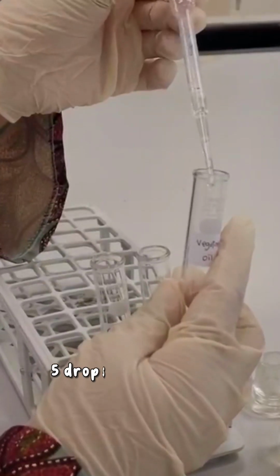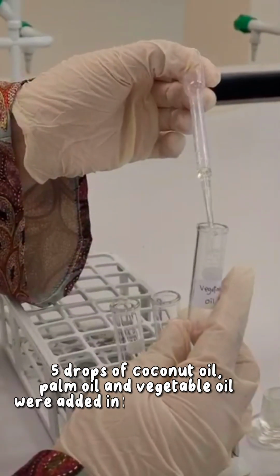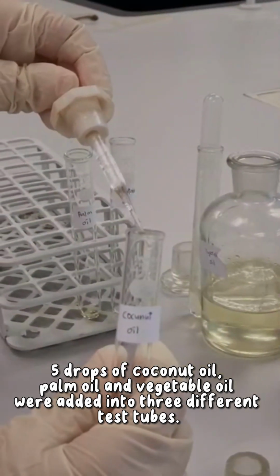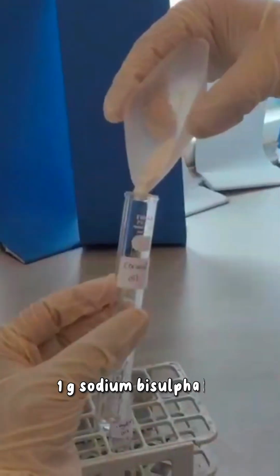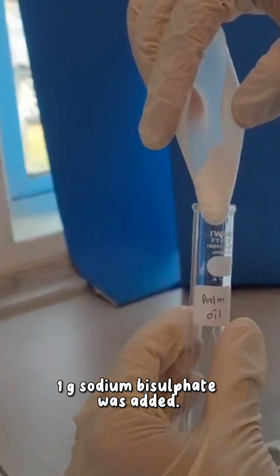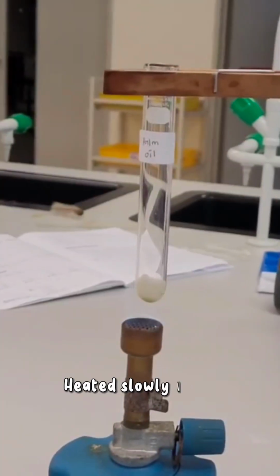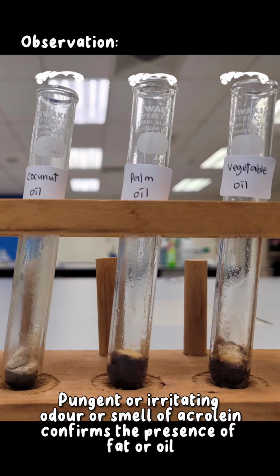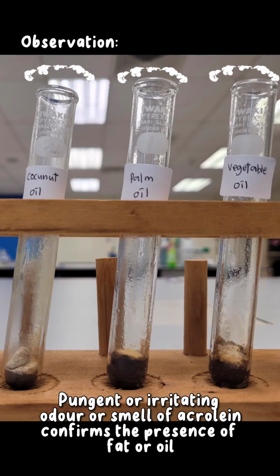Acrolein test. 5 drops of coconut oil, palm oil and vegetable oil were placed into 3 different test tubes. Next, 1 gram of sodium bisulfate was added and heated slowly using a Bunsen burner. The smell present was indicated and the result was recorded.